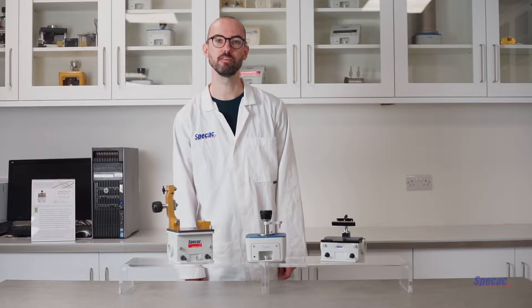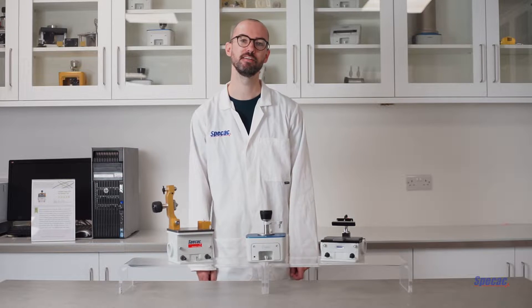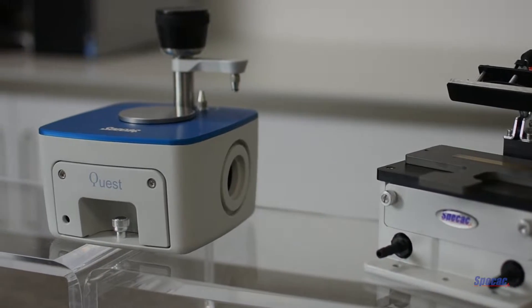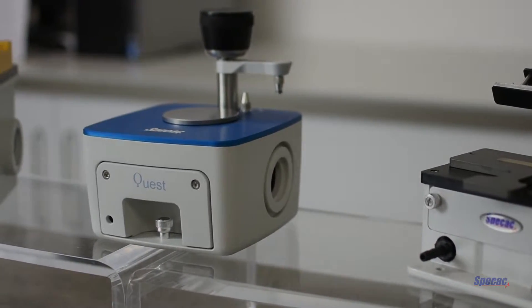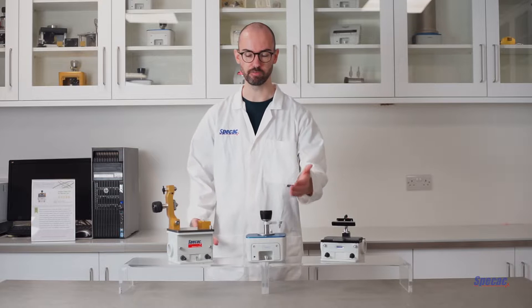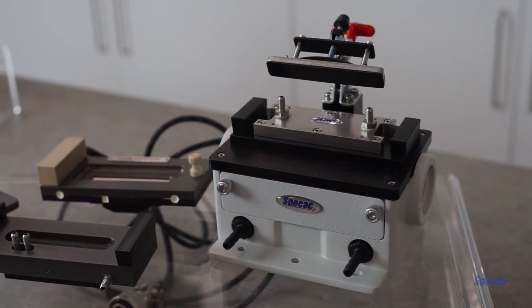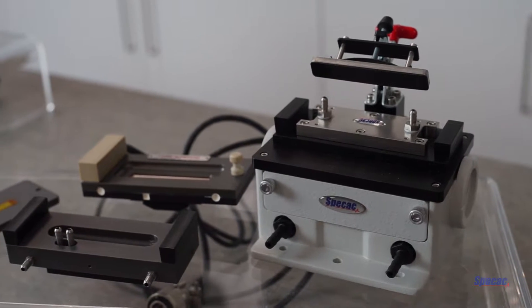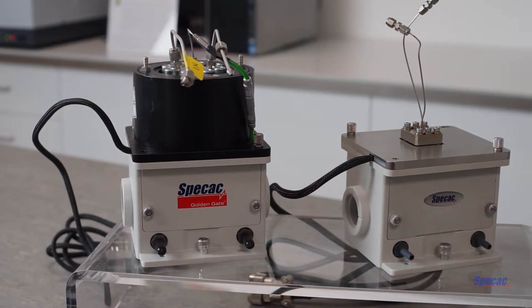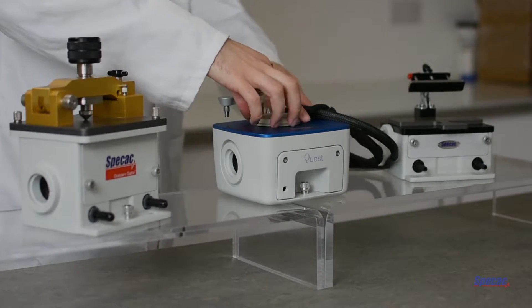Hello everyone, welcome to the Newton Demo Lab here at SPECAC. Today we're going to be looking at our family of ATR products. We have three of these products in our family: the Golden Gate, the Quest, and the Gateway. Each of them has many different options and configurations, too many to go through on one video, so we're just going to look at the main differences between them.